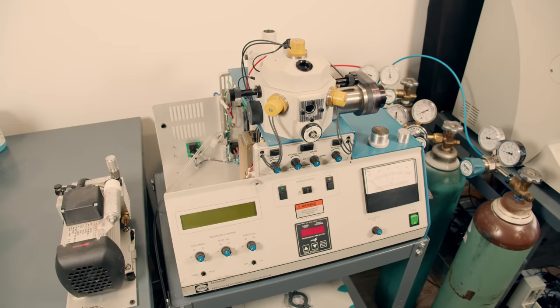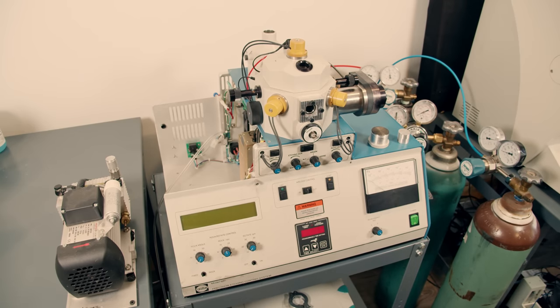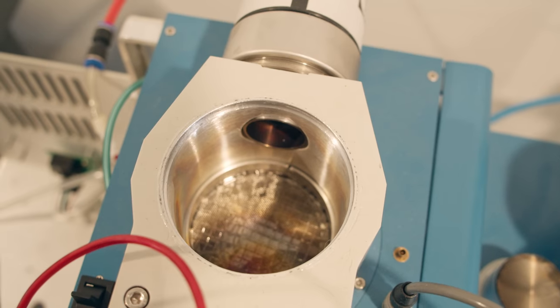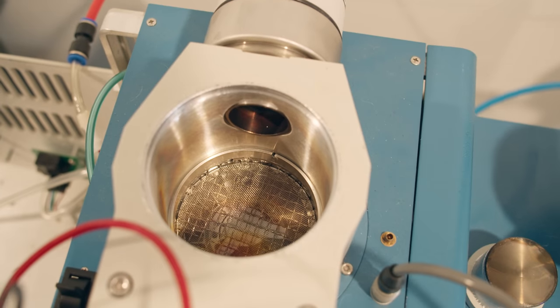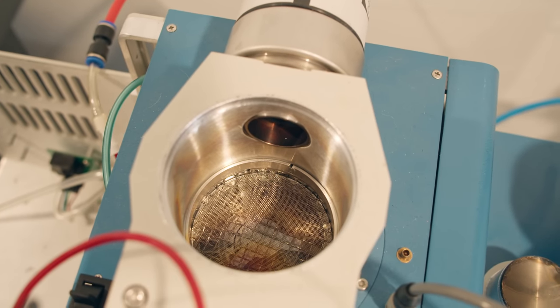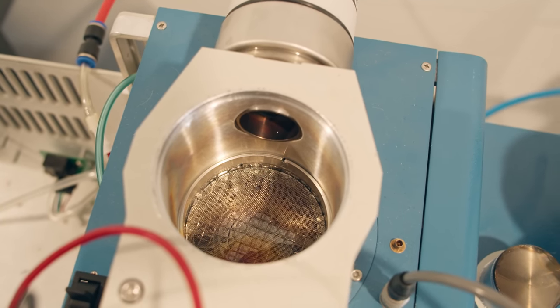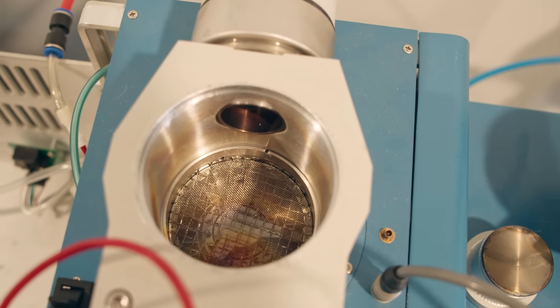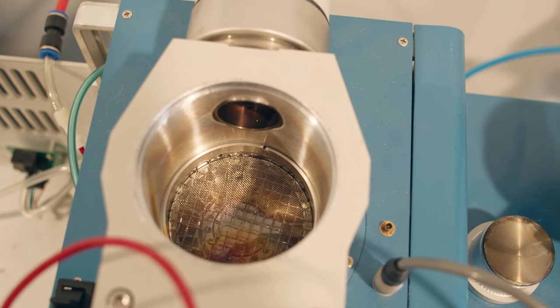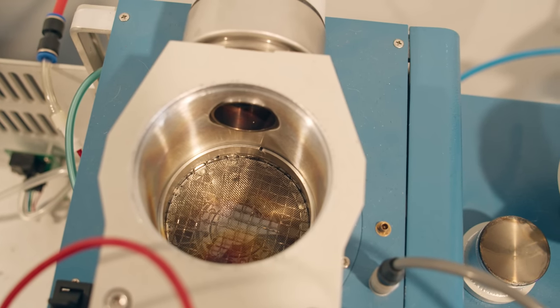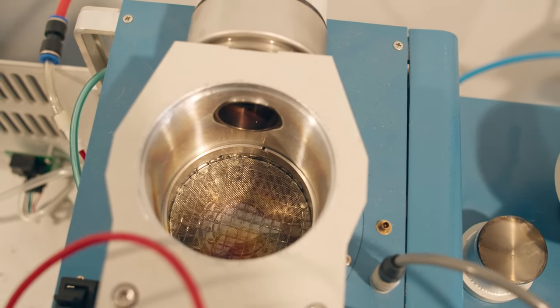So this is my ion mill. It's an old machine that I bought off eBay, and I've had to make a number of repairs to it. But I finally have it working, and I thought folks might want to see what it can do.